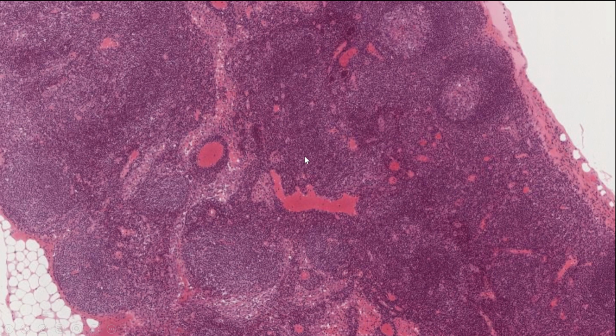Okay, so here we've got a little bigger zoom in of a lymph node. Here you can see all throughout the middle, that is just one medulla, one cortex on the outside. So we've got a lot of blood vessels in the medulla. Hopefully that helps you identify that. And then out here, this is not a medulla and a cortex, this is a follicle. This is one follicle, this is another follicle, this big kind of circle looking thing. And these ones do have those germinal centers, that lighter staining center where they're kind of fighting their fight, okay? And so these are the follicles.